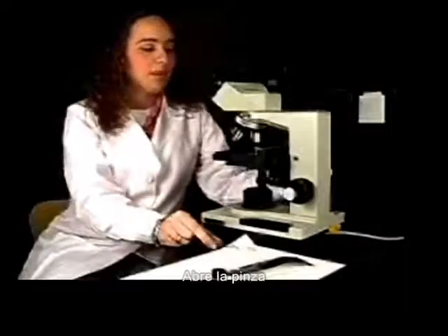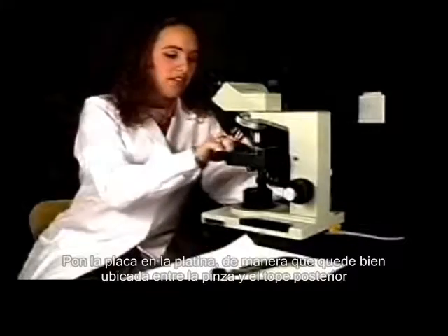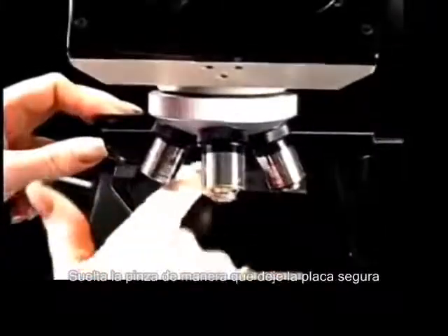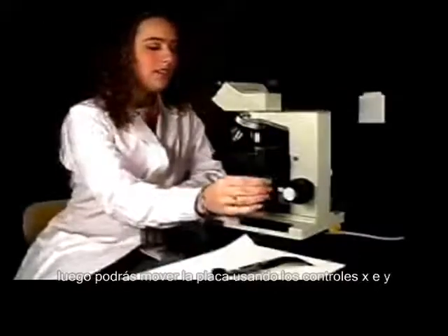Pull the stage clip open. Place the slide on the stage so that it fits into the corner of the slide holder. Release the stage clip so that the slide is held securely. You can then move the slide using the XY controls.